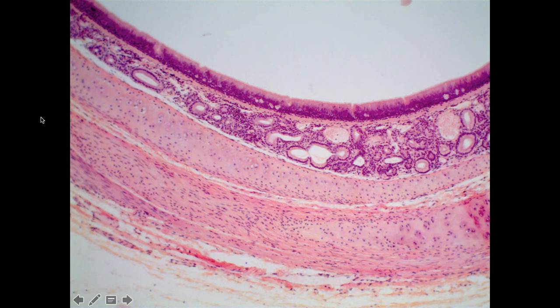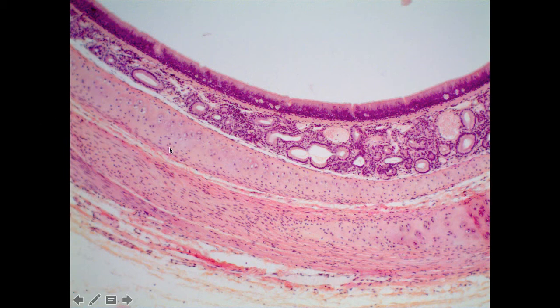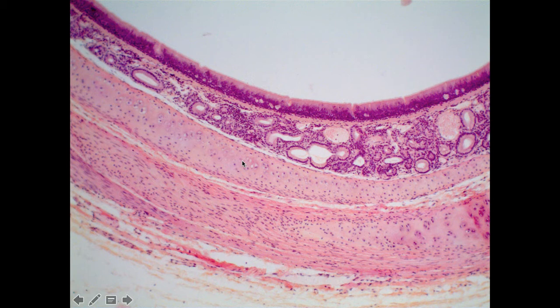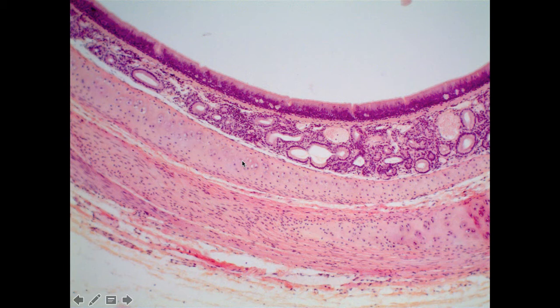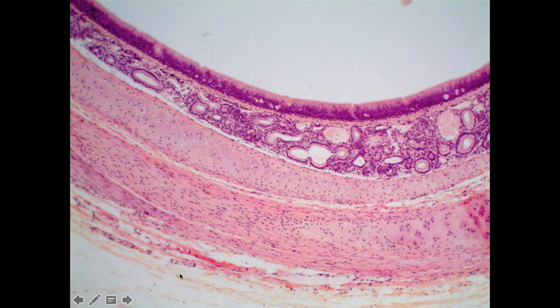This first one here is the trachea. Like the other mucous membranes in the digestive system that we've looked at, there's going to be the mucosal layer, then a submucosa. In this case, we don't have a continuous muscularis layer, but we have a cartilaginous as well as muscular layer. And then finally, on the outside, we're going to have adventitia.